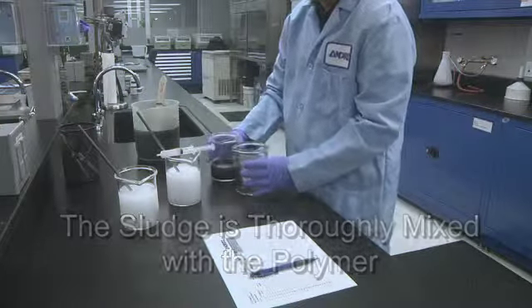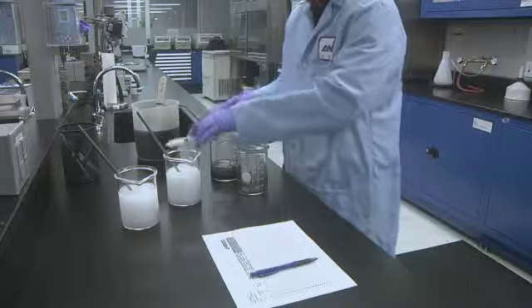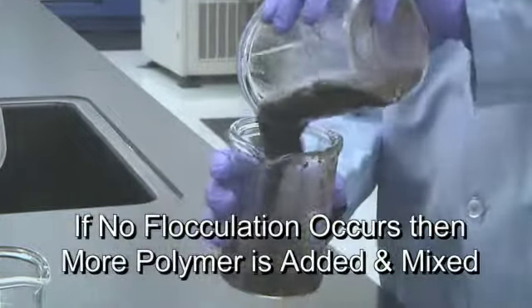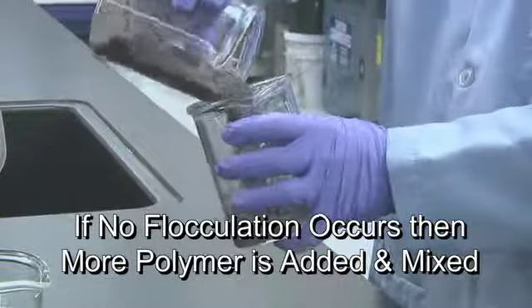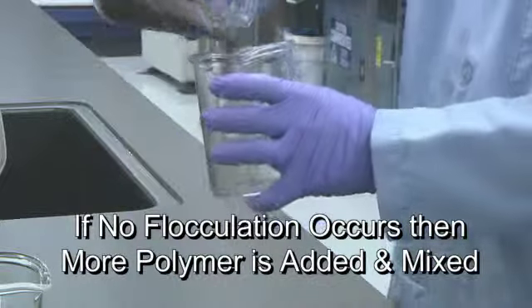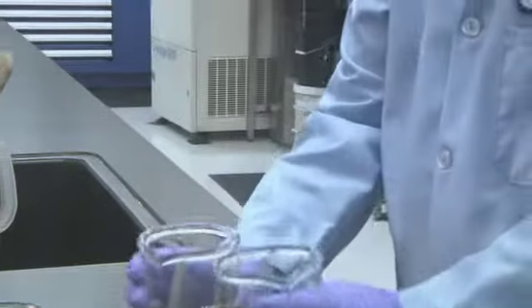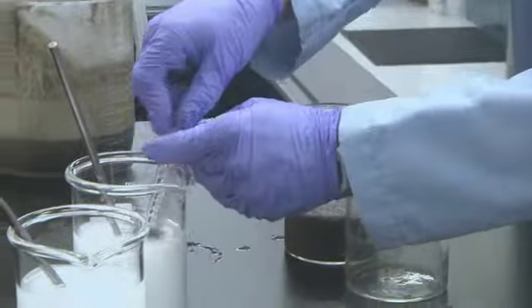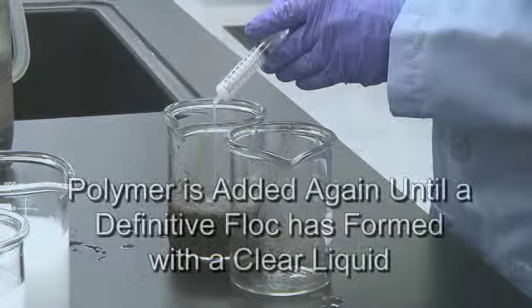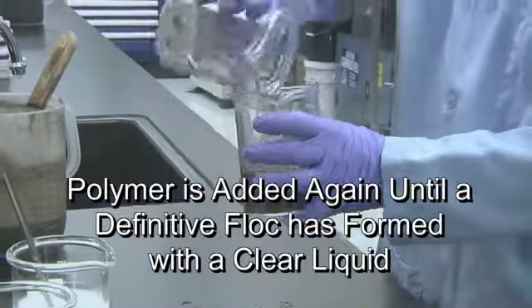If no flocculation occurs, then more polymer is added and mixed. Polymer is added again until a definitive floc has formed with a clear liquid. After these tests, the polymer that gives the best drainage at the optimum dosage can then be subjected to dewatering or thickening testing.